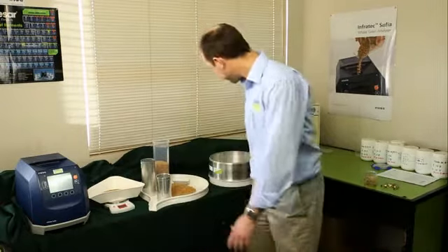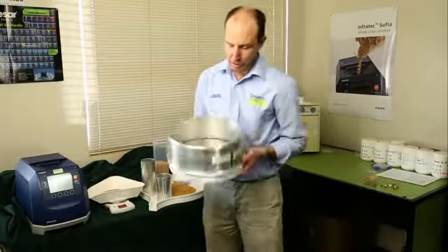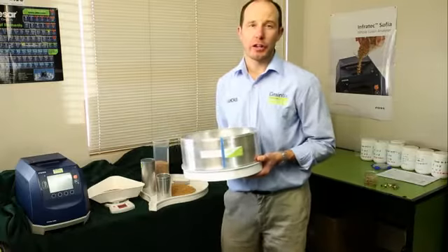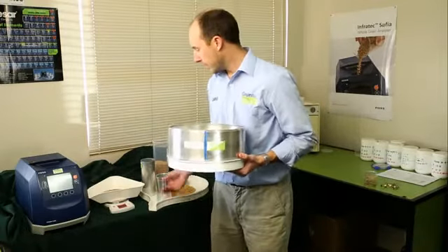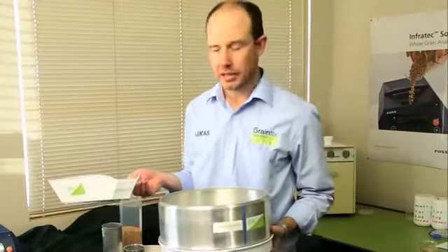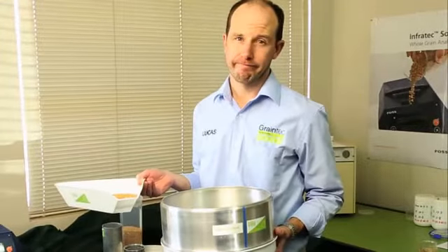This is a short lesson on how to measure screenings. You'll need your grain screen. In this case, I'm measuring wheat. And you'll need a 500 mL grain sample. In this case, I've just measured the test weight using a 500 mL sample, so I'm going to use that.